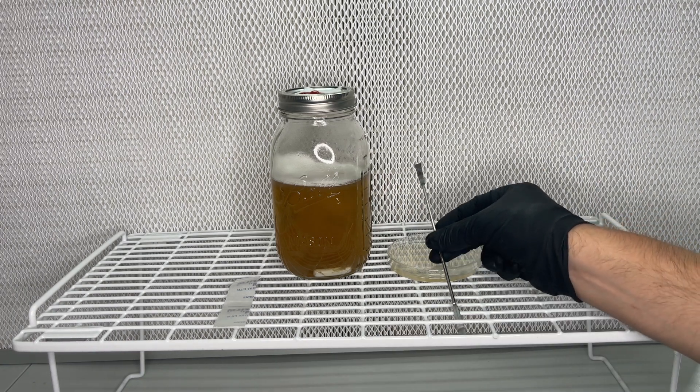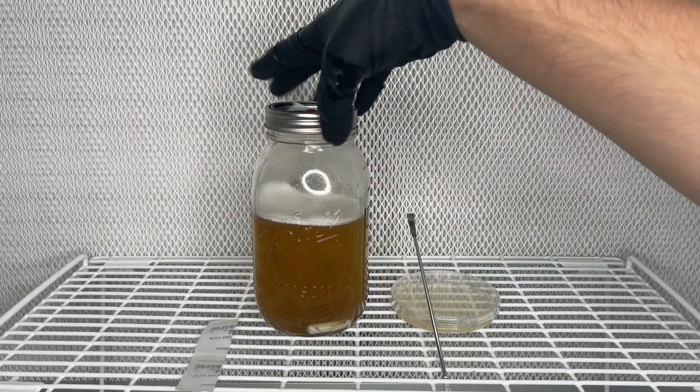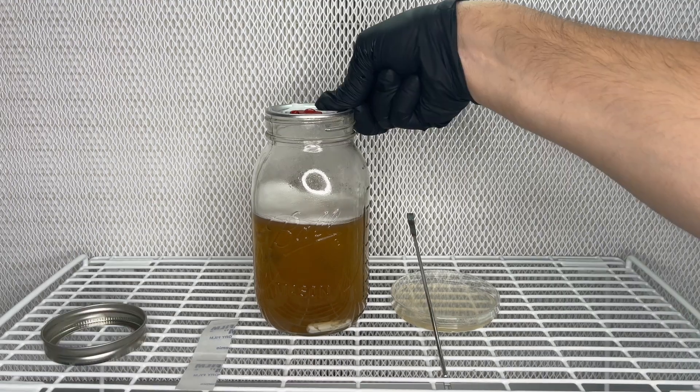And that's exactly what I do here using a flame sterilized scalpel to reach into the jar and grab that mycelium off the side of the glass.